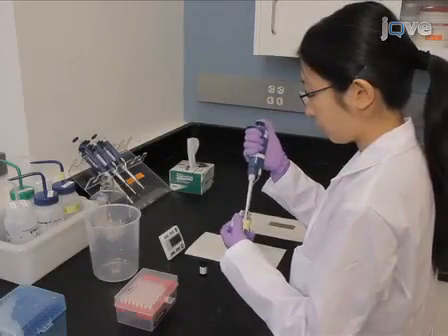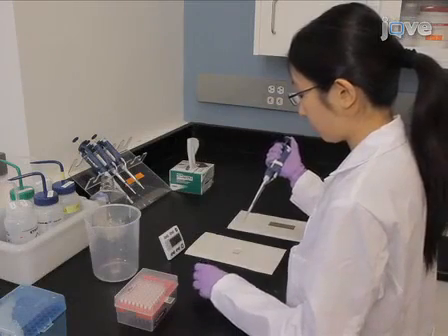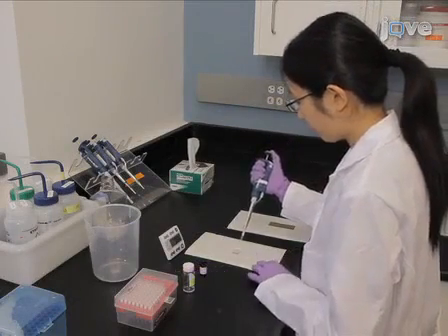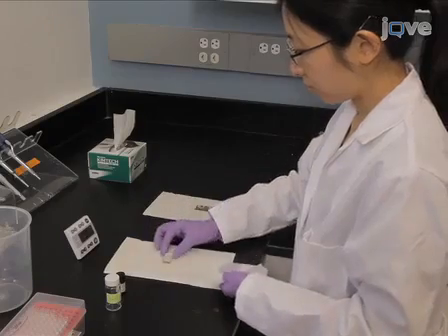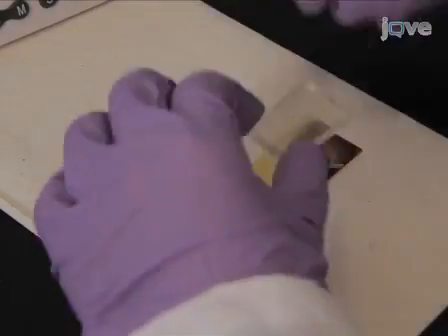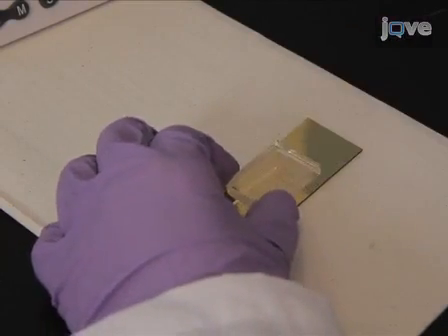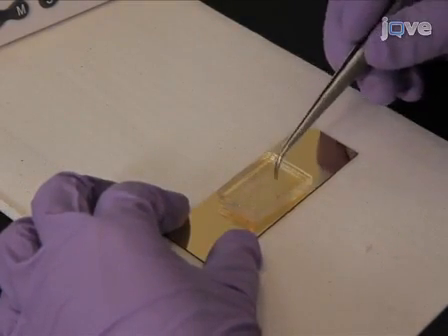Microcontact printing is used to create alternating patterns of self-assembled monolayers of PEG molecules on the gold substrate. First, ink the PDMS stamp with 5 millimolar PEG solution in ethanol. Dry the surface for 20 minutes. Gently put the stamp on the gold surface for 40 seconds and make sure there is a good contact between the gold surface and the stamp. No excess pressure is required.